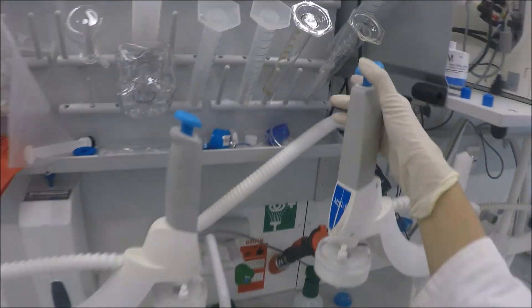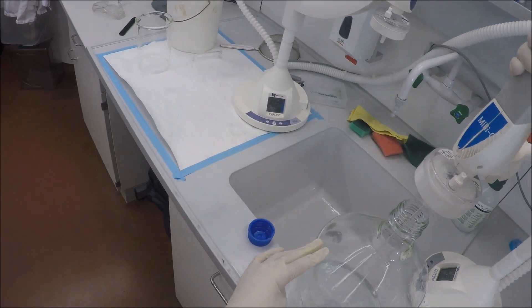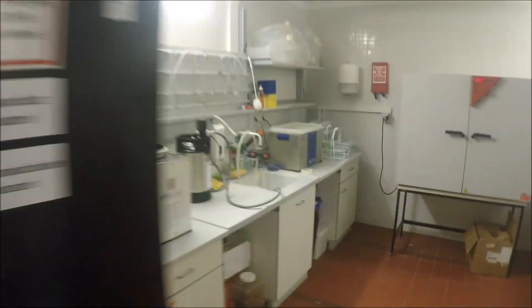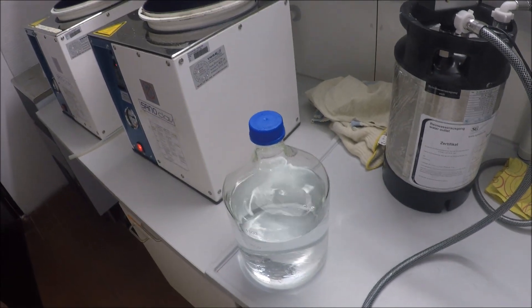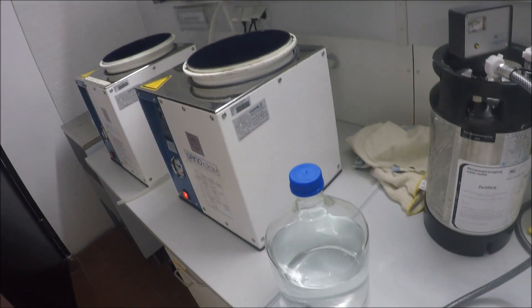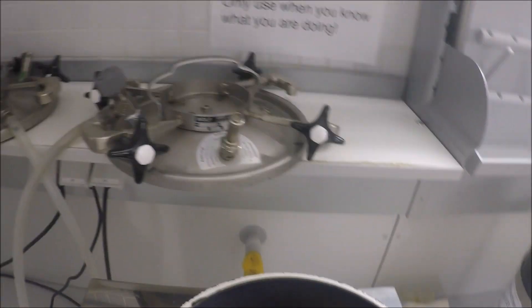Now that I have my salts in all the correct amounts, I have to add water. In this case we add sterile water so that I'm sure that the artificial seawater I'm preparing is as clean as possible. This here is an autoclave — this white cube. Basically this is a container that increases pressure and temperature. I want to use it to sterilize my water, to make sure that if there is any bacteria or any other kind of organism inside, it will die, because otherwise it might ruin my experiment.